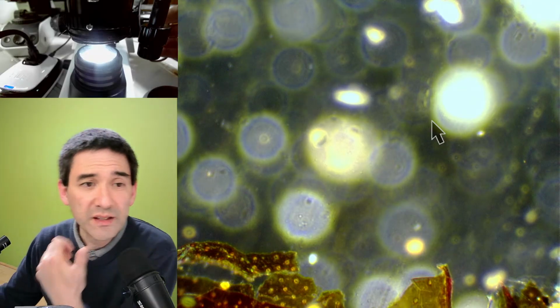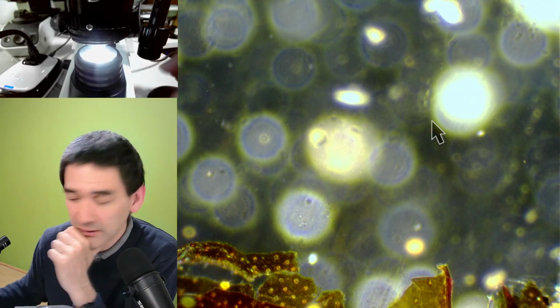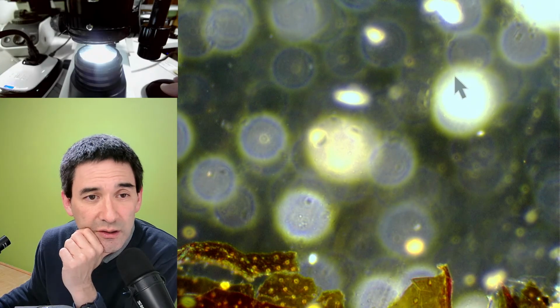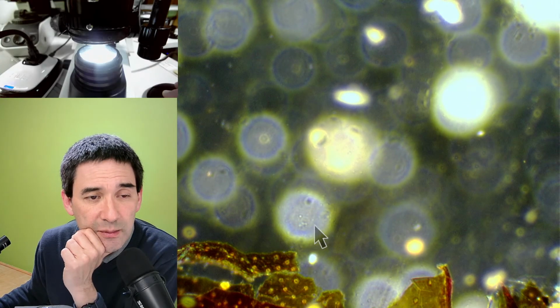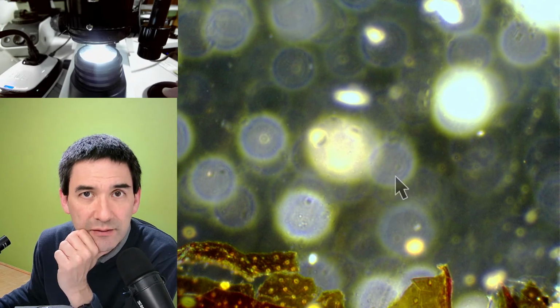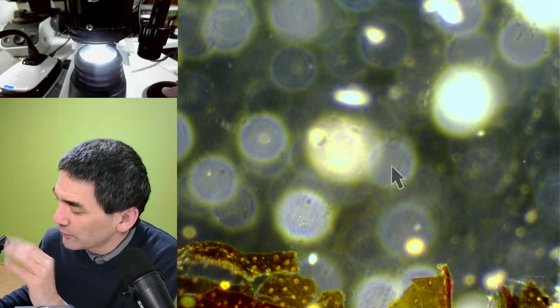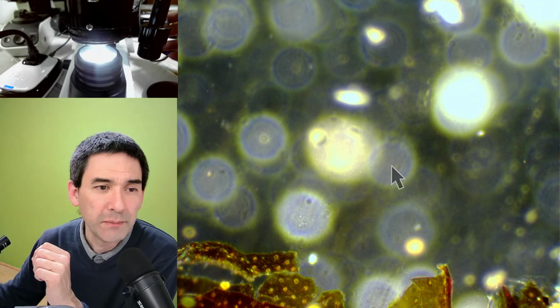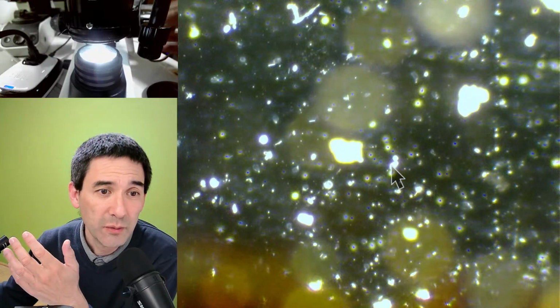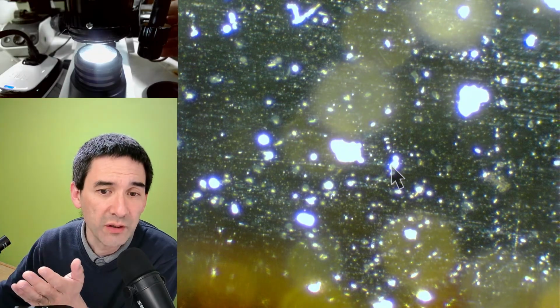and that's a little bit one of the disadvantages of using dark field. Do you see all of those white spots here? That's all dust. Yeah, so dark field is unfortunately extremely dust sensitive. If there's somewhere a little bit of dust in the light path, then it will look like this. Yeah, we can try to focus. So that's basically on the slide.